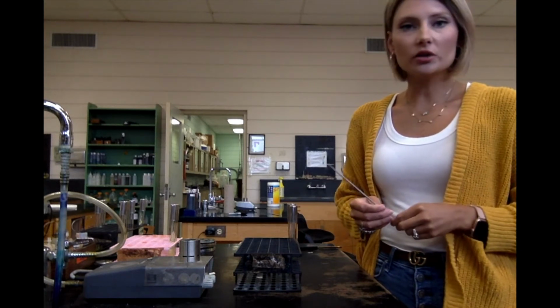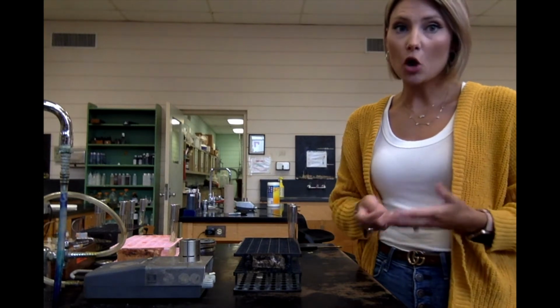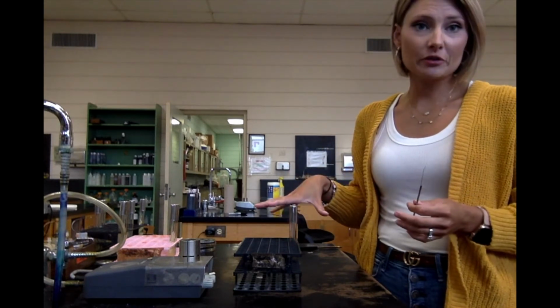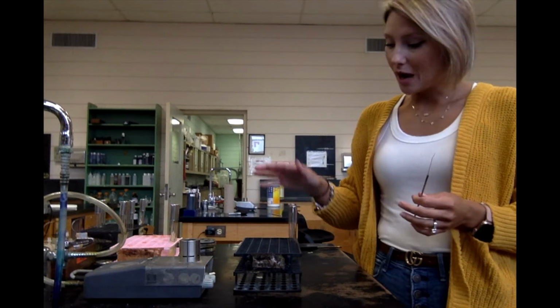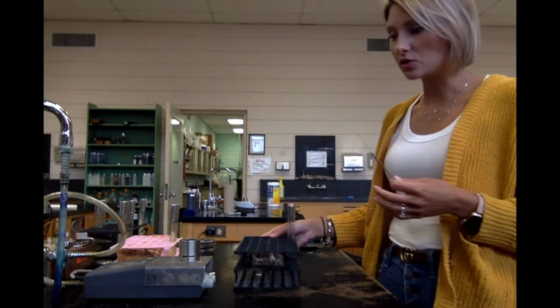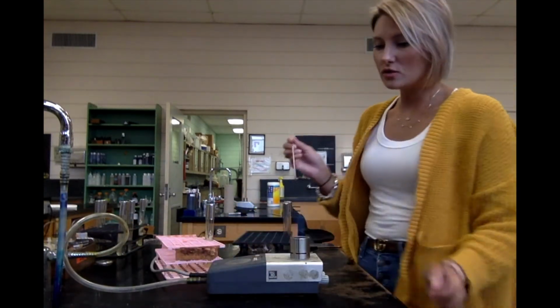So, like I said earlier, the SIM stab is a stab just like the Motility. So you should already know how to do this, but I am going to demonstrate it for you again. Now, the results that I have are for 3 different bacteria. I've already done this 3 times for 3 different bacteria, but I'm only going to demonstrate it once for you, because once you do it once, it's pretty straightforward after that. So I'm going to, again, use aseptic technique.